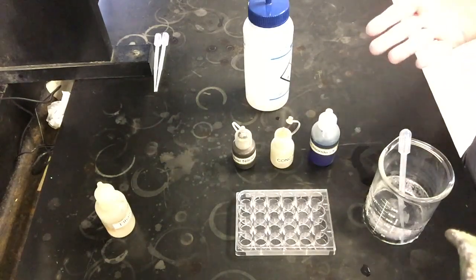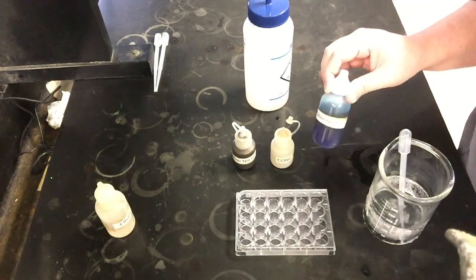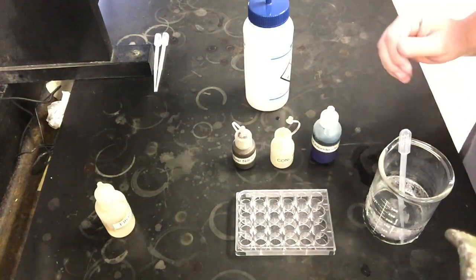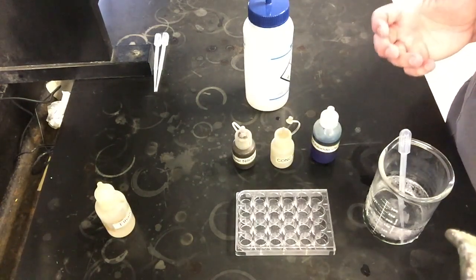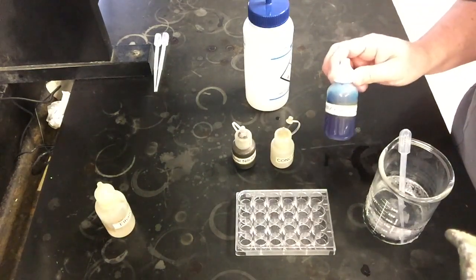Right, so our last reaction we're going to take a look at here is going to involve a cobalt chloride compound that's dissolved in ethanol. That's the ALC abbreviation that you see on the bottle. Apologize for the glare that's there. And that's important because that means water in this reaction that we add is actually not the solvent, it's going to be a reactant.